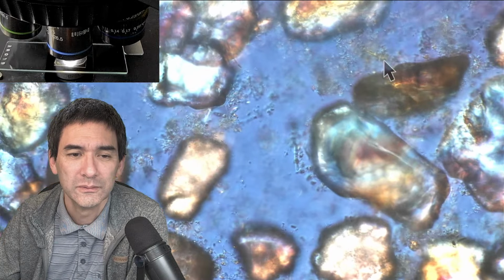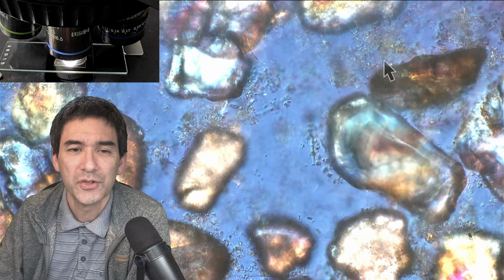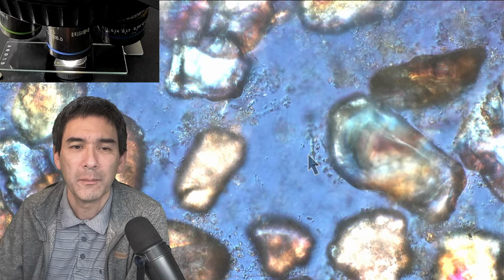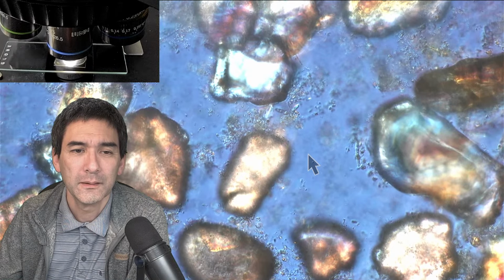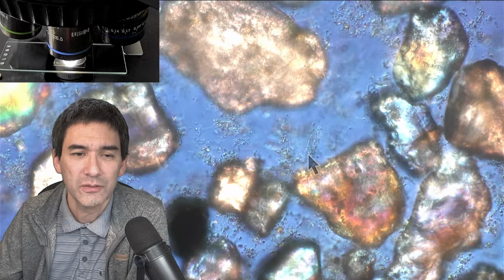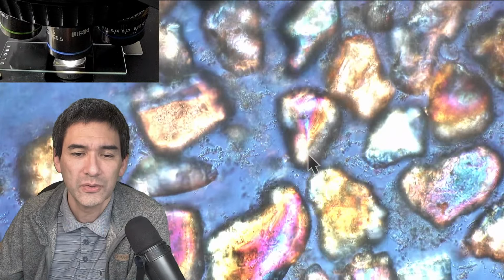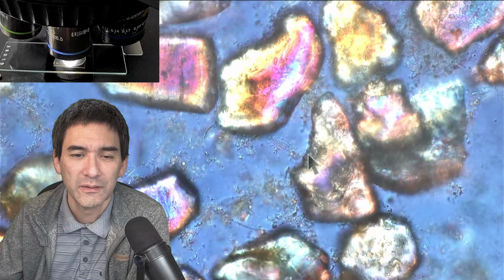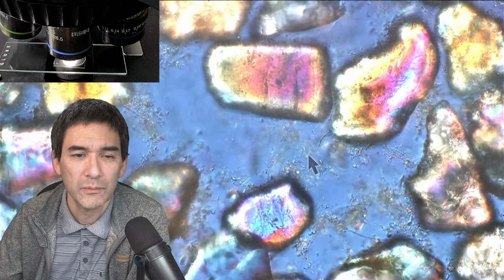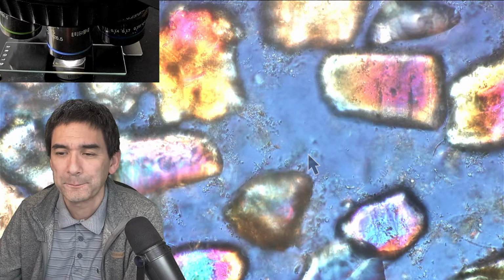So here we go. Yeah, this here could also be those. You just have to always look at those regular structures. This could also be a diatom. Yeah, but I think it's pretty evident that 3 years is not going to... Yeah, it's not alive anymore. There seems to be a little bit of movement sometimes, but then again, it looks more like Brownian motion. Yeah. Okay.